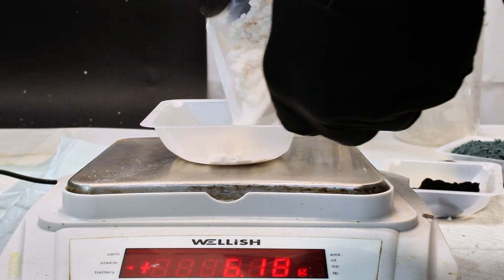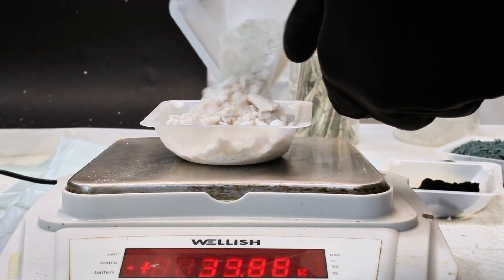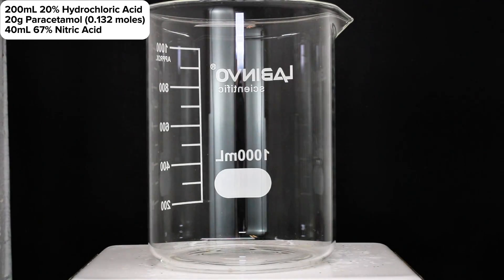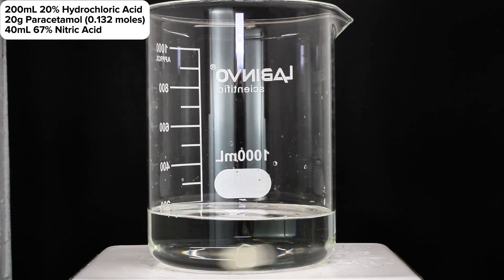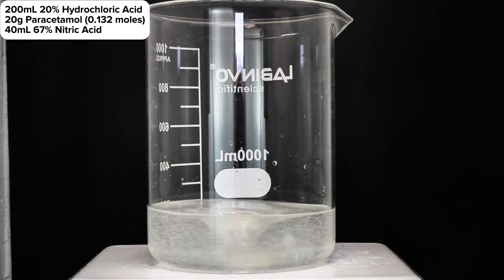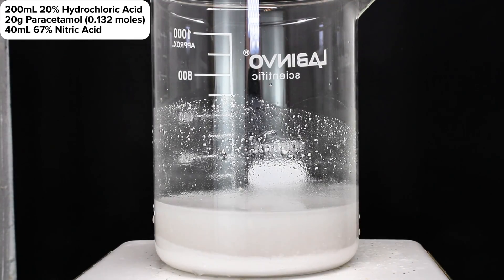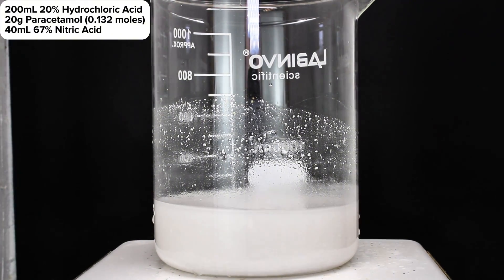Anyway, once I had finally filtered off my pure recrystallized paracetamol, I allowed it to dry and weighed it for a final mass of 43 grams, which is far more than I needed for this reaction. To begin the reaction, I first added 200ml of 20% hydrochloric acid to a 1L beaker followed by 20g of the paracetamol. Without applying any heat, and under constant stirring, I next added a small amount of 67% nitric acid, and allowed it to stir for a minute before adding any more.